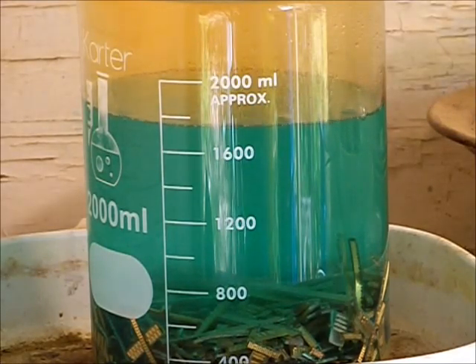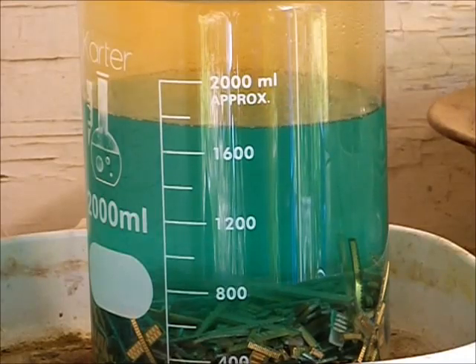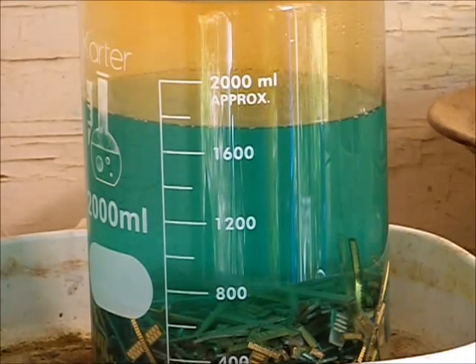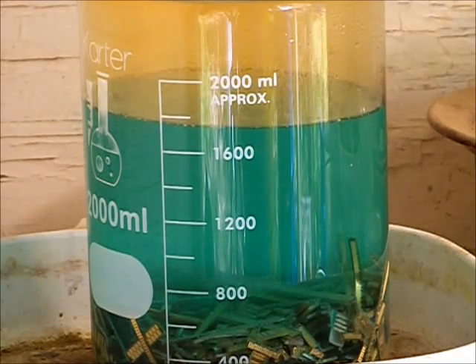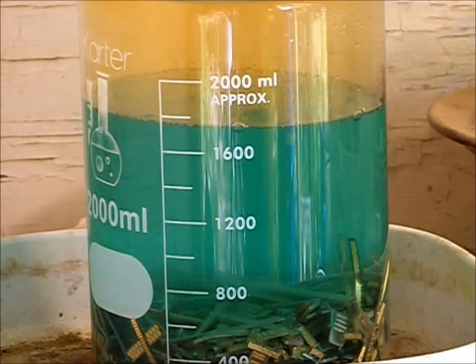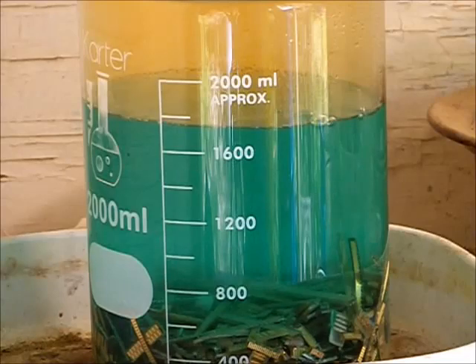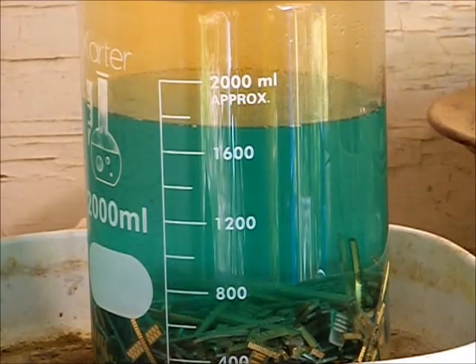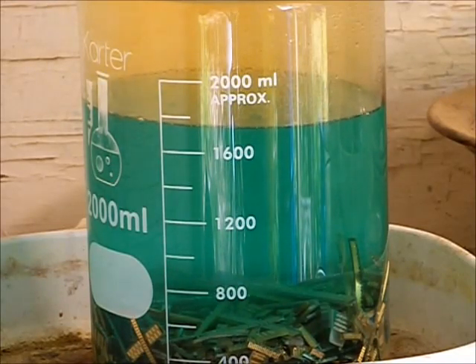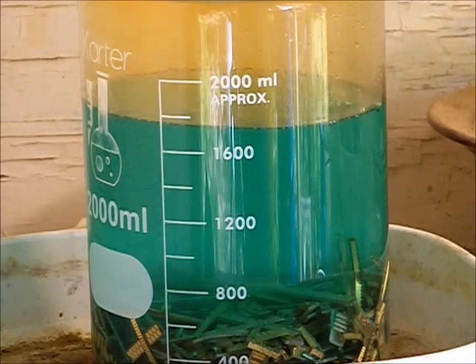As this heats up in the bottom, the reaction will get more vigorous and start generating tiny little bubbles. It's a very subdued type reaction, so it's not really that big a risk of a boil over. That's one of the reasons why I like this process. You pretty much can set it and forget it, come back a few hours later, check on it. It's a lot cheaper than nitric acid, and for those of us that can't get nitric acid or it's too expensive, this is a cheap alternative.